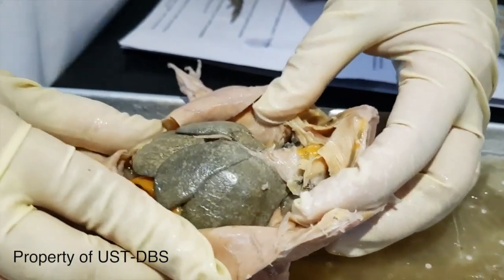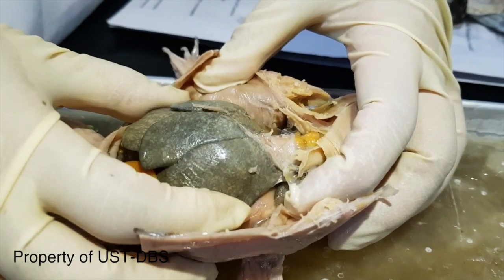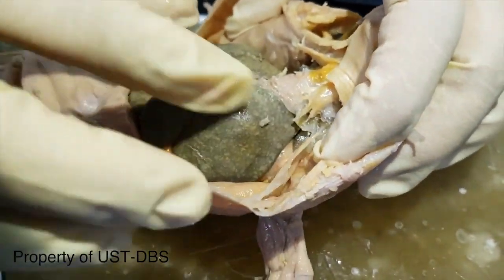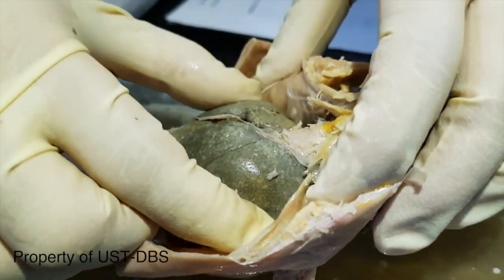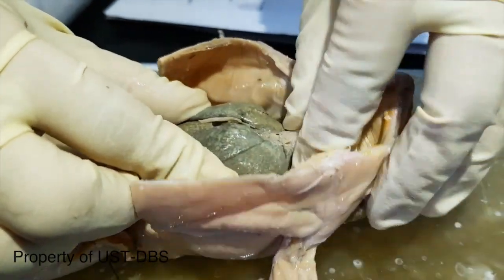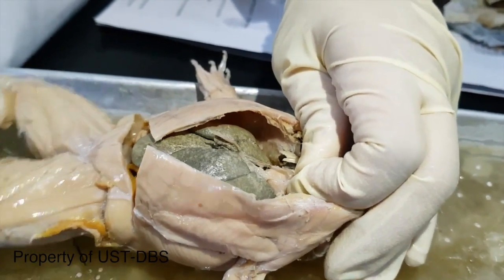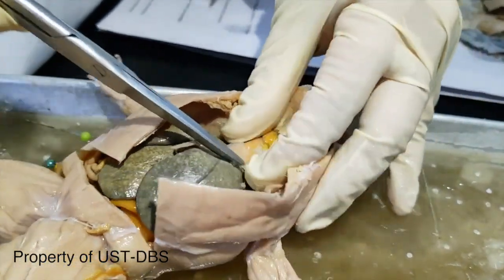Okay, so when you open the frog, the visceral organs are revealed, and you can actually see some cavities present in the area. Most of the organs for digestion are found in the abdominal cavity. This is the pericardial cavity for the heart. The one that covers it is the pericardial sac. You can actually cut it to reveal the heart inside.